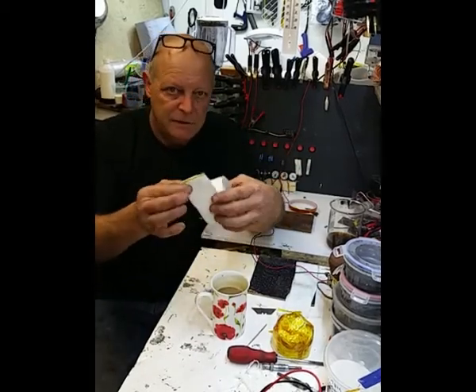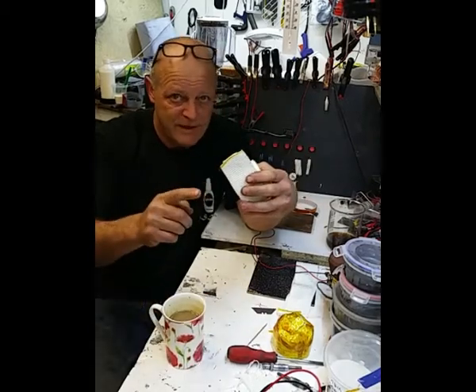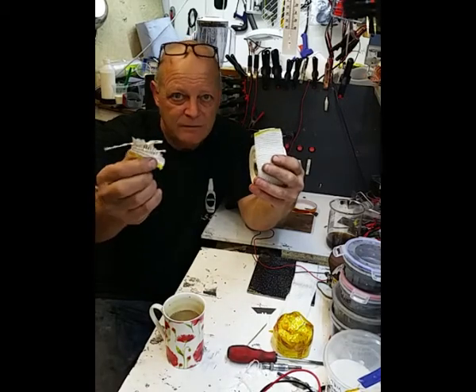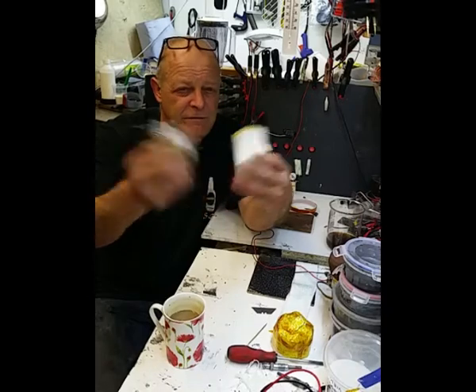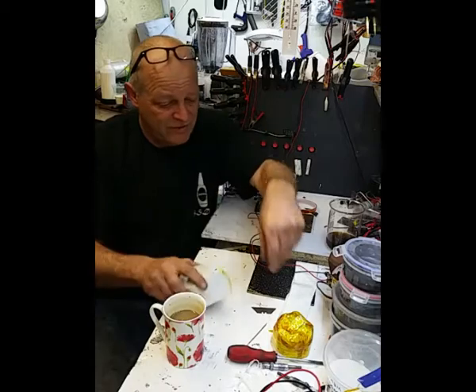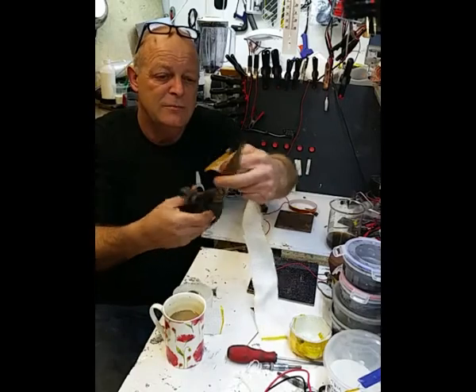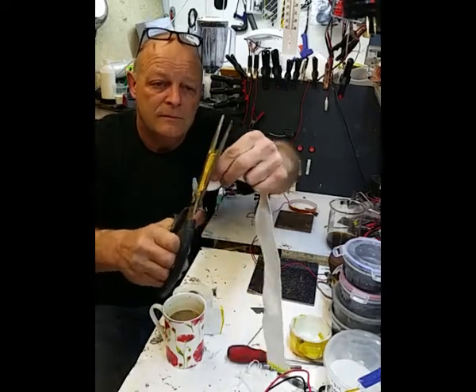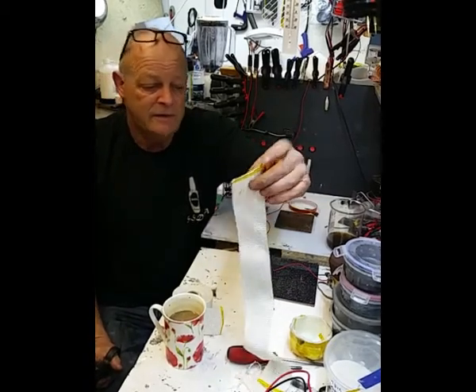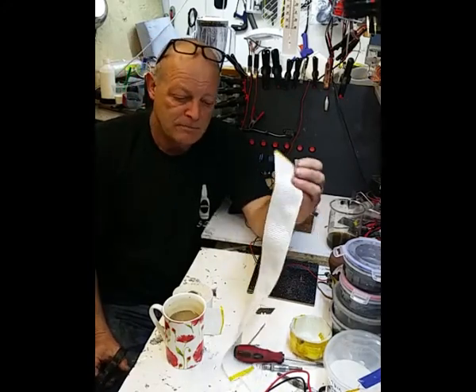But if you ever use this stuff and you try and cut it, put some tape on it, because it frays like mad. It's a bit like my carbon fibre weave. It just frays like mad, so you have to put some tape on it. Otherwise you're in a world of hurt with it. It's terrible stuff. Just as an example, you get a lovely cut and the edge stays fine. Now, depending on what you're doing with it, that's Kapton tape, which I've used in this instance. So that's that.